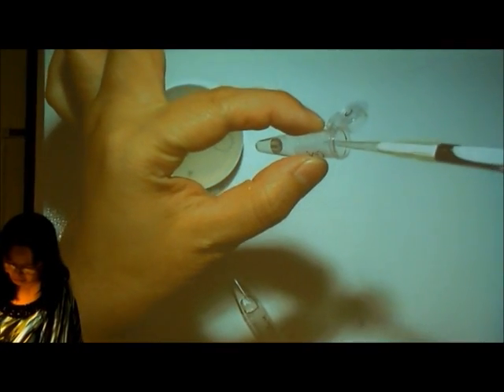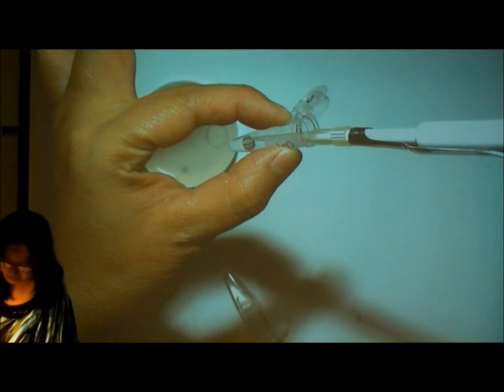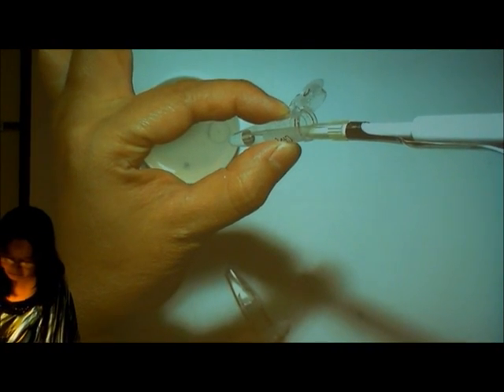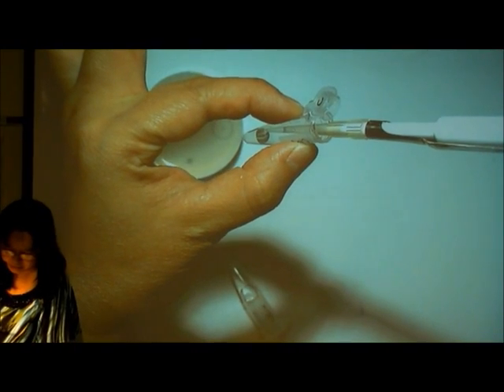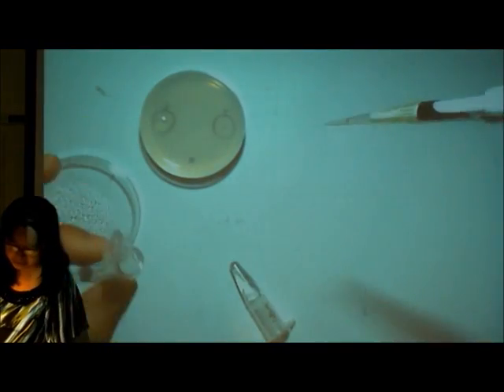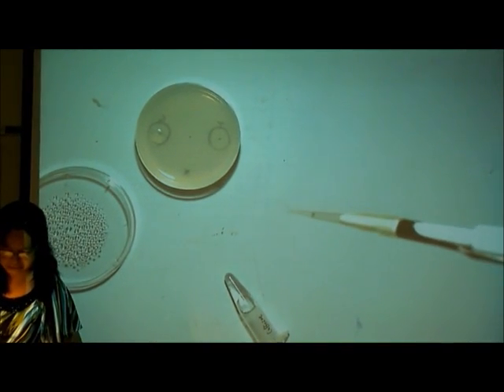I forgot to show you how to take the liquid. Just beneath the surface of the liquid, slowly take it up. And try to do it as vertical as possible with your pipette to get the accurate volume.